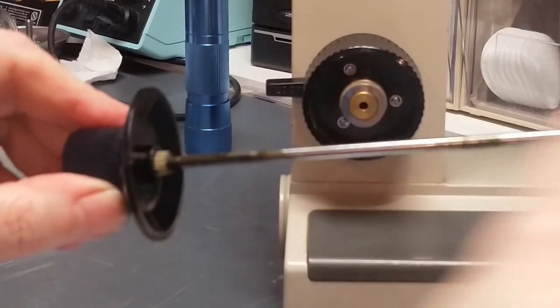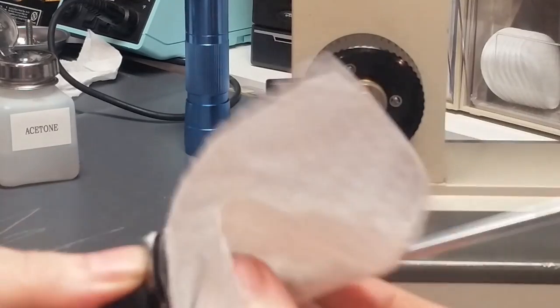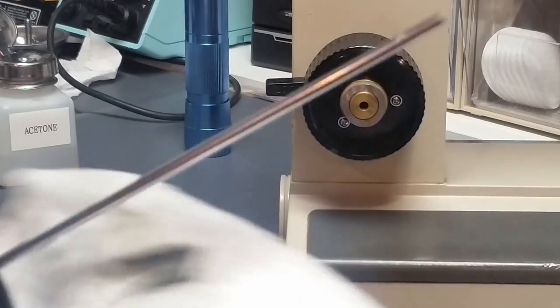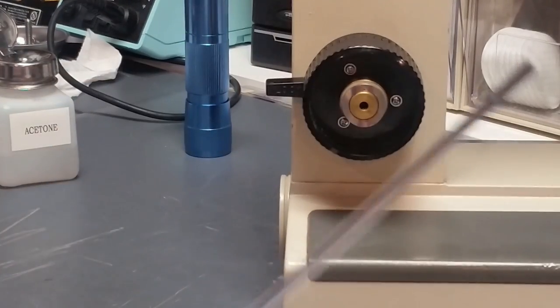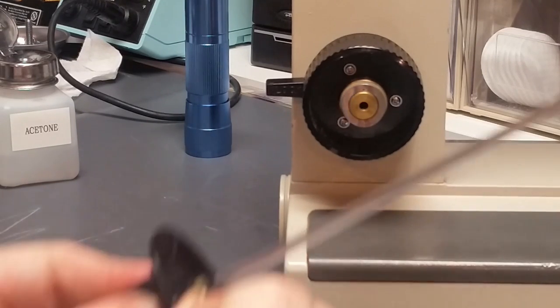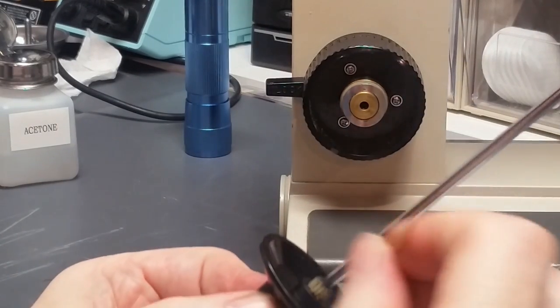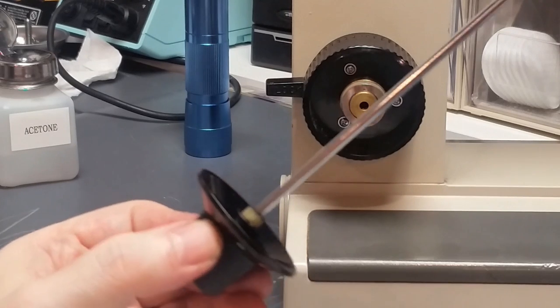Okay, I'm going to clean off all the old grease from this fine focus shaft here. I want to put it together with new grease, and I don't want the old grease to be on there mucking up the works, literally. Okay, so that's pretty well clean. I'm going to take a toothpick and run through the teeth on this gear to make sure that there's nothing in there that's going to interfere. I'll do that off camera. I'll be right back.